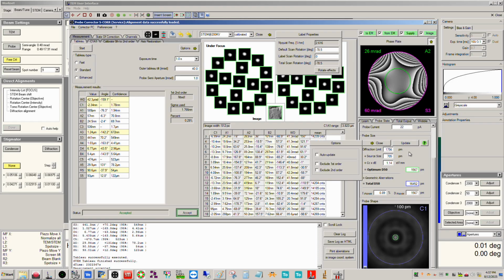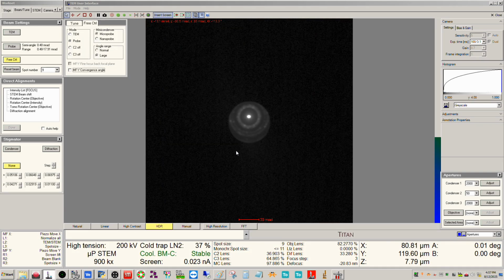Let me uncheck this because we don't need this to auto update. But this is a quick way to estimate your probe size. So we're certainly not doing anything at atomic resolution with these settings.